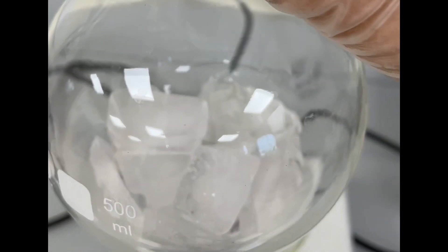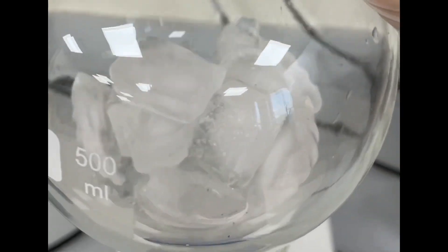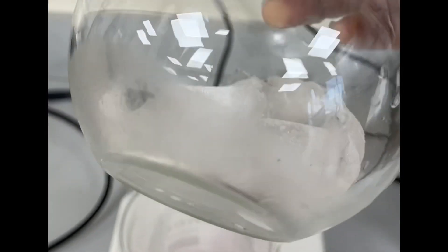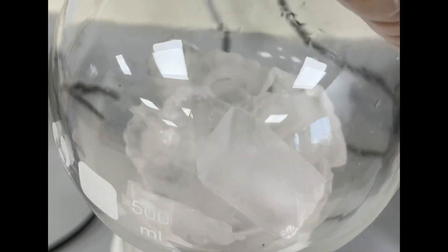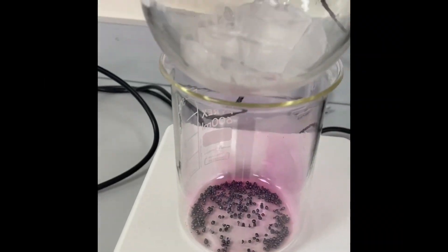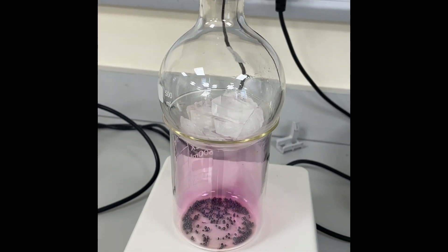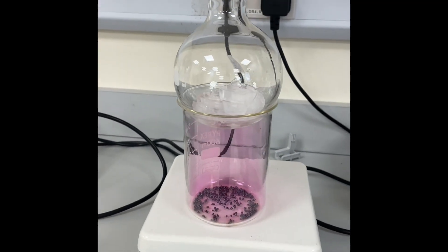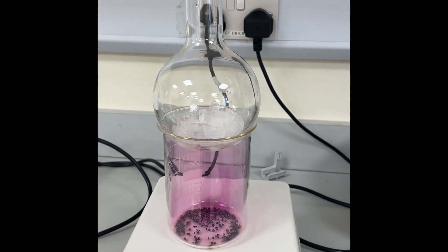Meanwhile, I'm also taking a round bottom flask with a bit of ice in it for the iodine vapors to condense on the surface, so that you can see some iodine crystals forming there. I'm going to put the round bottom flask on top of this so that some condensation happens and we can get some iodine crystals.